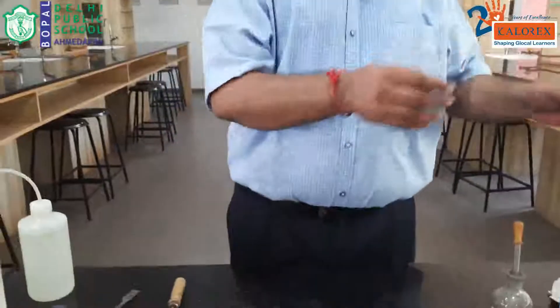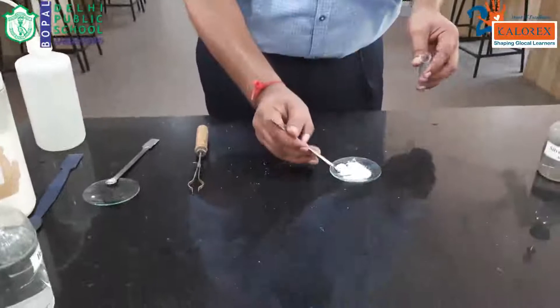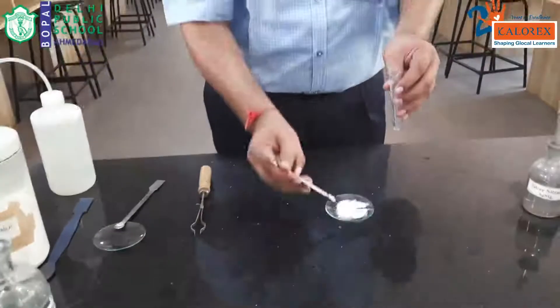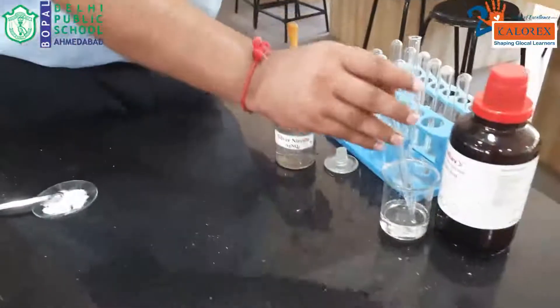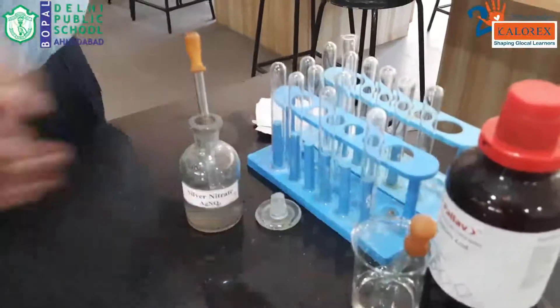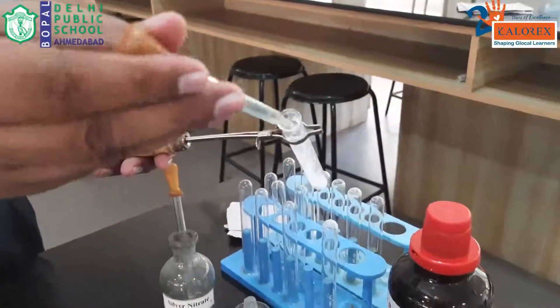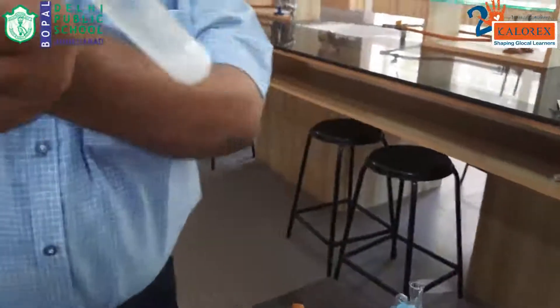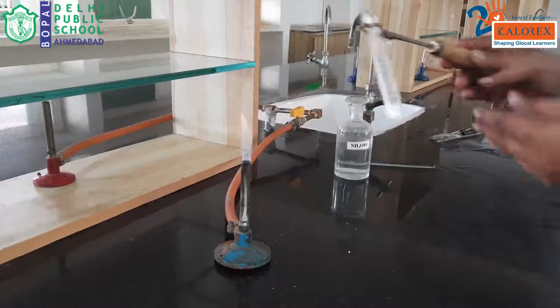Taking an absolutely dry test tube, adding a pinch of salt, and adding concentrated sulfuric acid. Using a test tube holder and adding the concentrated sulfuric acid carefully. You can see bubbles coming out. Let's see what kind of gas we are getting when we heat it slightly. There are some vapors coming out.